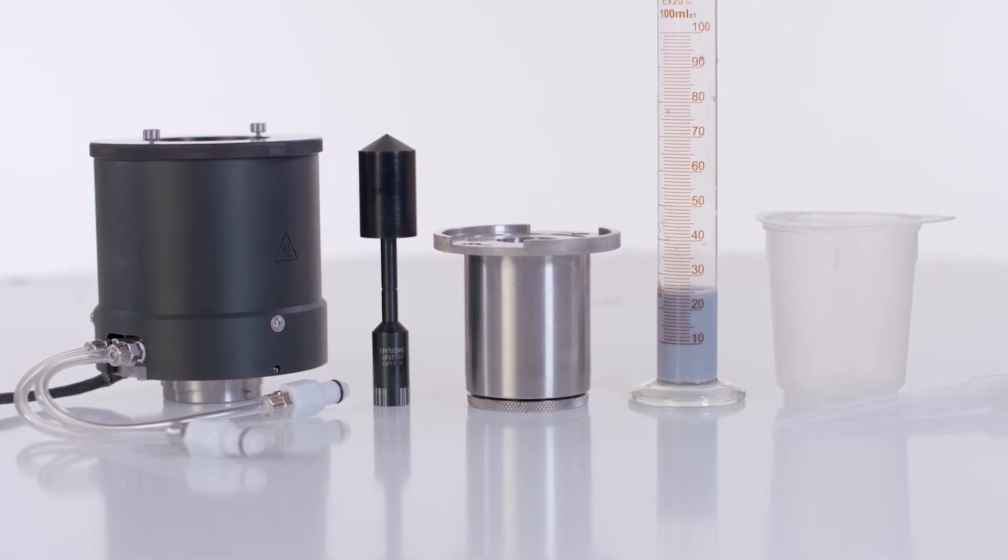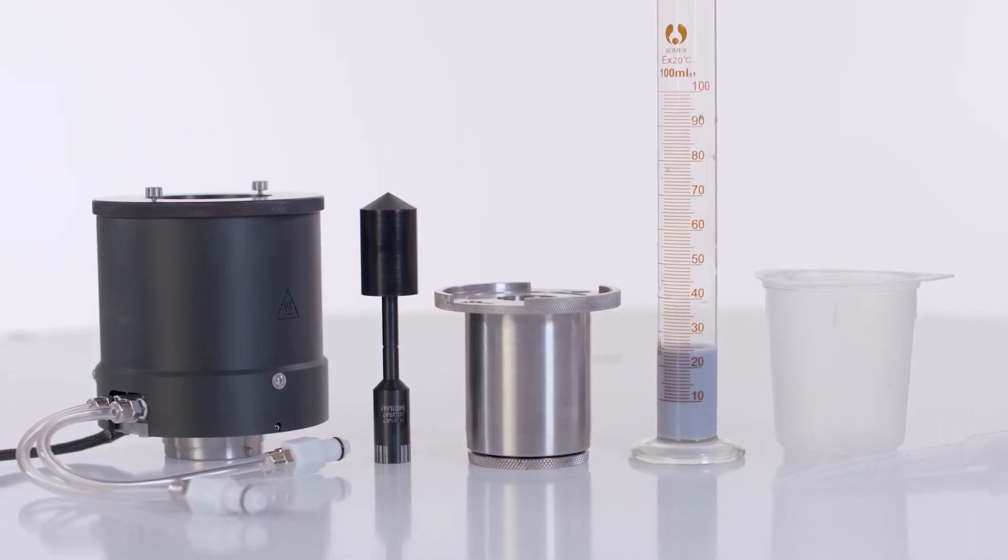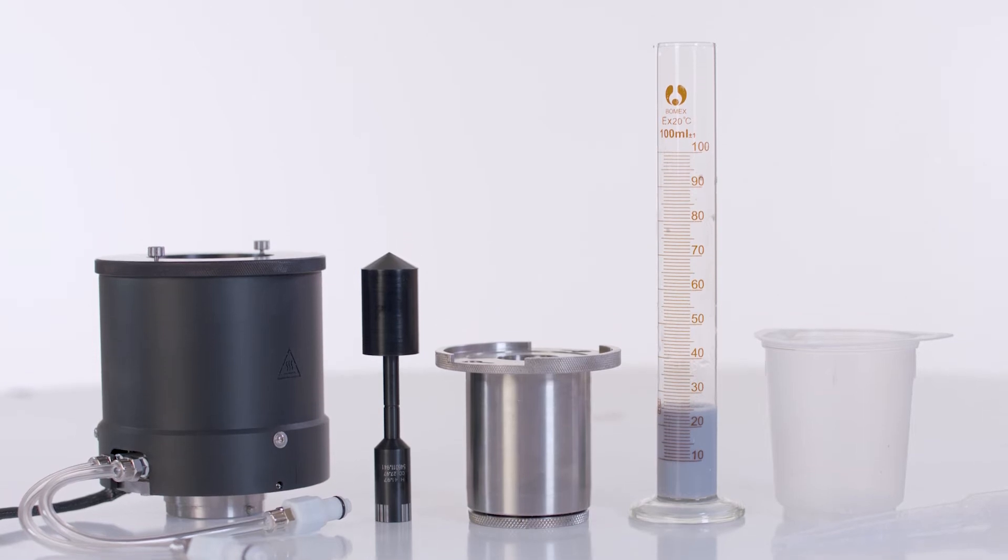Concentric cylinder geometries allow for the rheological characterization of low viscosity fluids and suspensions.